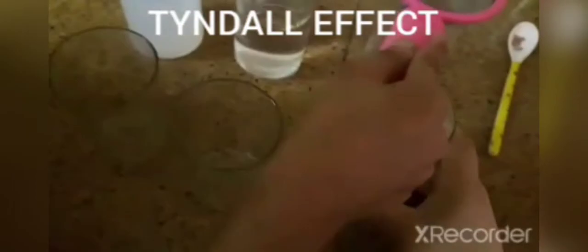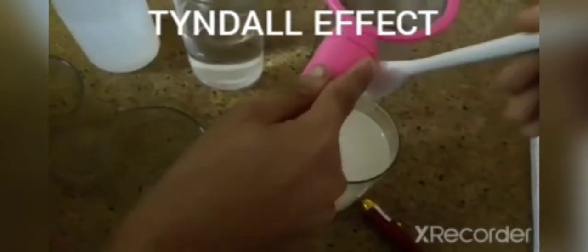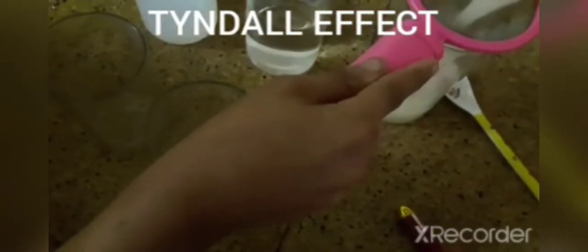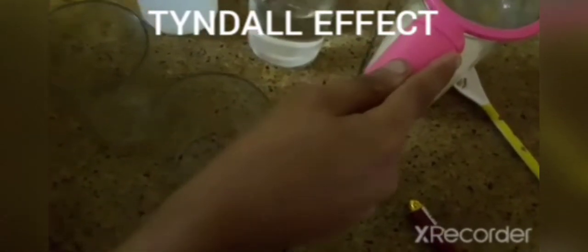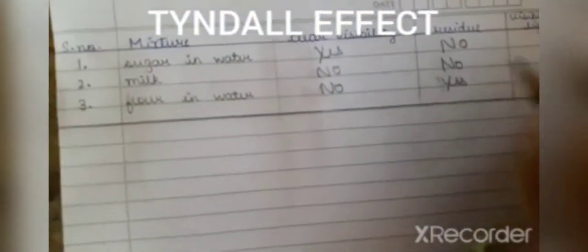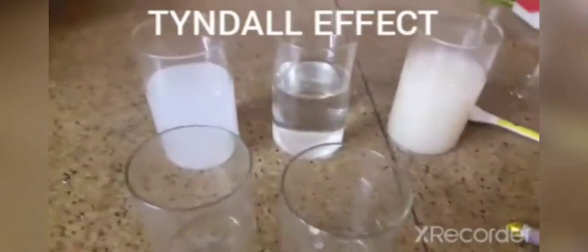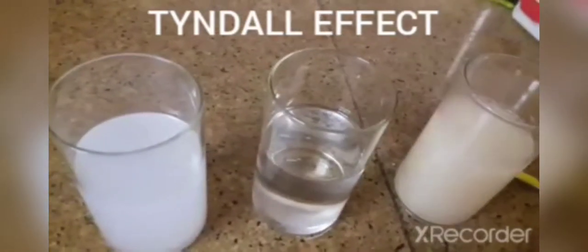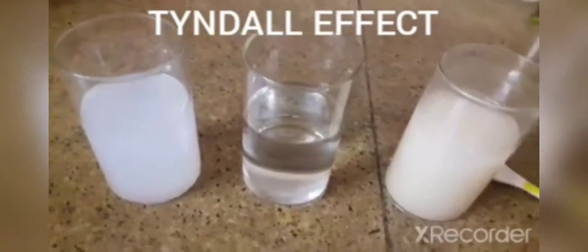The third one is flour in water, which is a suspension. Let me just stir it. Now there is a residue left in a suspension, so therefore we'll have it as yes, because a suspension has its particle size between 1000 nanometers and more than that too. So the third experiment is whether the visibility of light's path is there or not.